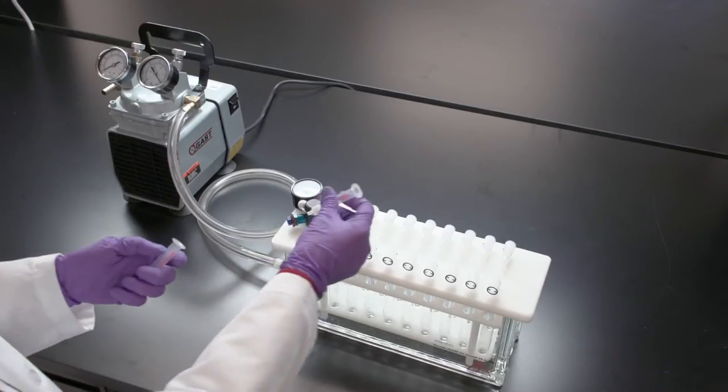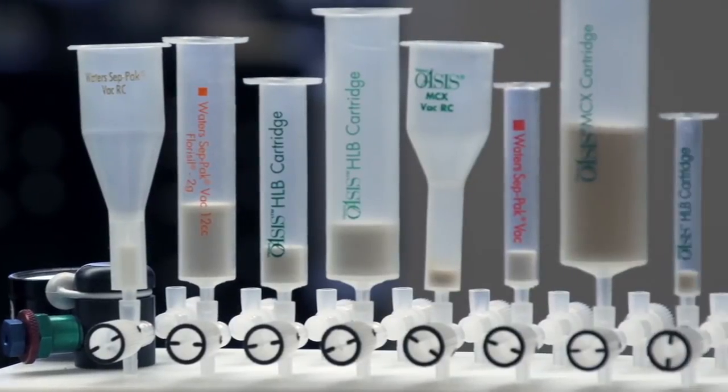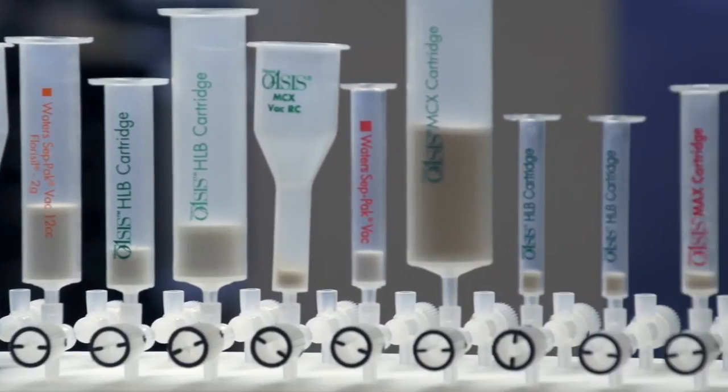Position the cartridges on the stopcock. As you can see, there is a wide variety of cartridges that can be used with the cartridge manifold.